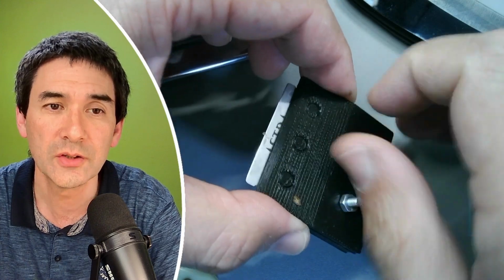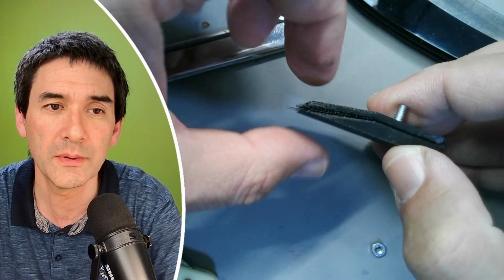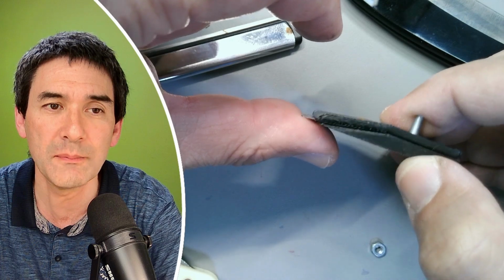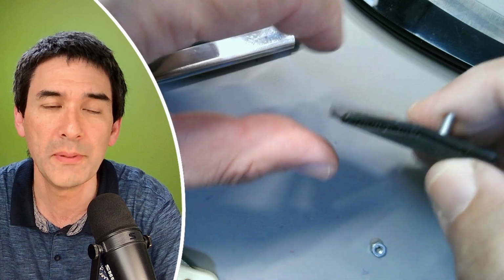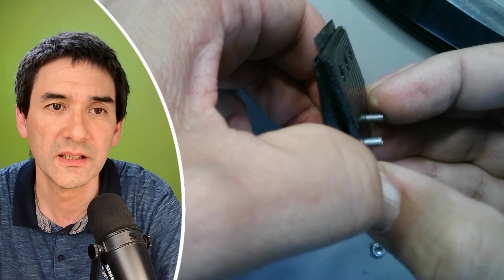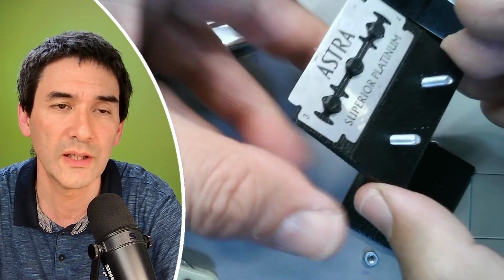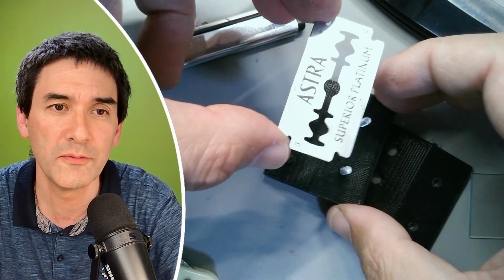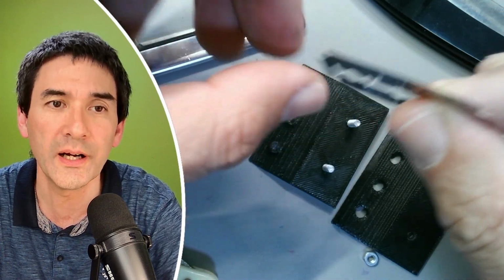I found this one to be consistent, right? I just want to open it again, and I just want to show you why this is so important, because you see that there's a certain angle here, right? So this means that the blade will actually press lightly against the surface of the microtome. So it will bend up slightly, and in here, when you open it up, you can actually, of course, see the blade, and it can also be turned around. And you can also see here now how extremely flexible it is. Yeah, and this is something that makes it unsuitable without a holder.